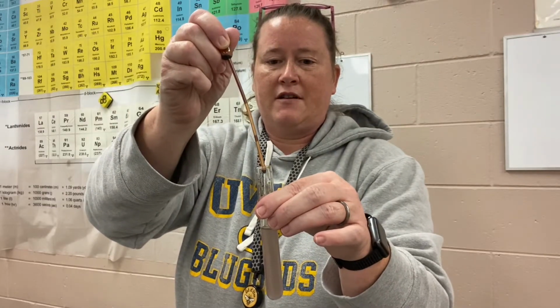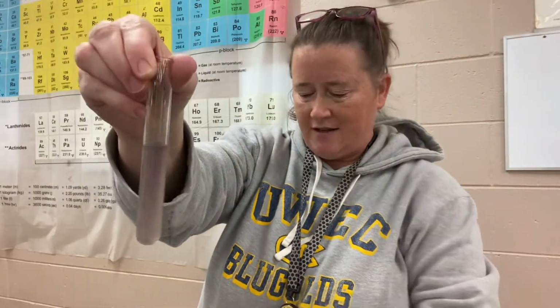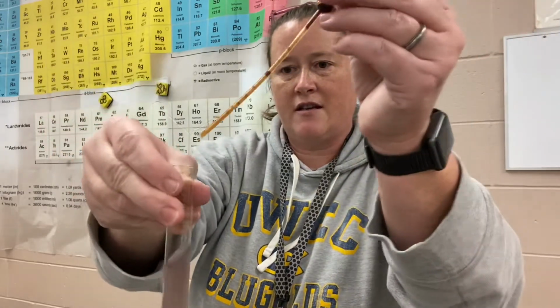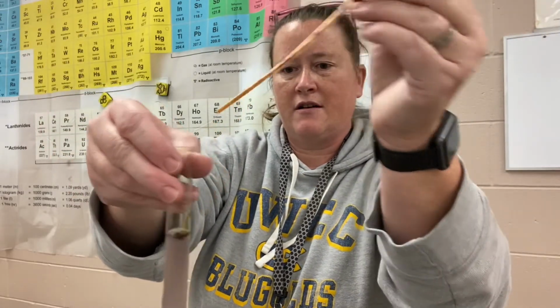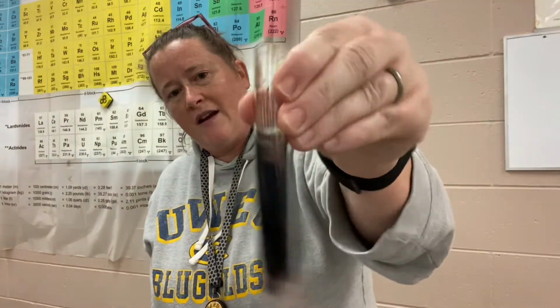Let's see. It seems like there's still some vitamin C in there that it's reacting with. It's really crazy. I didn't even put that much in there. That purple is just lingering, but it's definitely disappearing some. So there is still some vitamin C in there reacting. I'm thinking maybe there might not be any more vitamin C in there reacting.